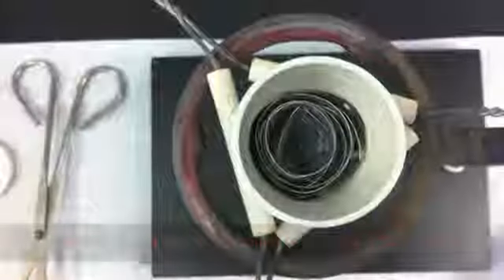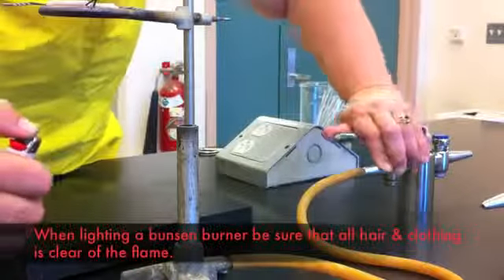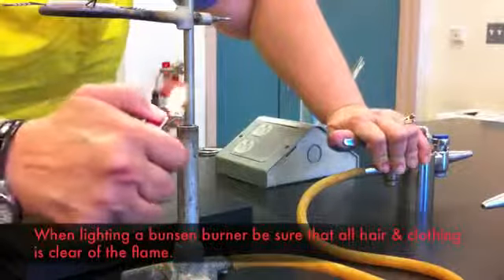Do not wrap the magnesium ribbon too tightly. Air needs to get in for the reaction to take place. When lighting a Bunsen burner, ensure that anything flammable such as hair or clothing is well out of the way.